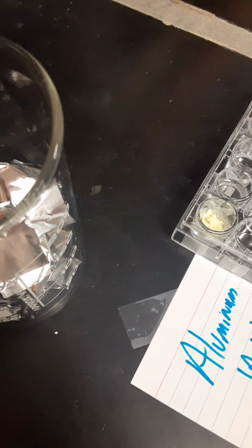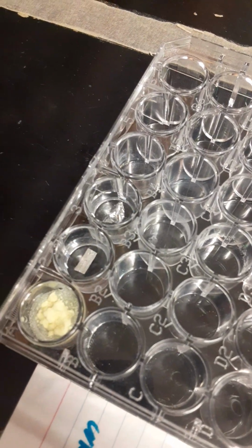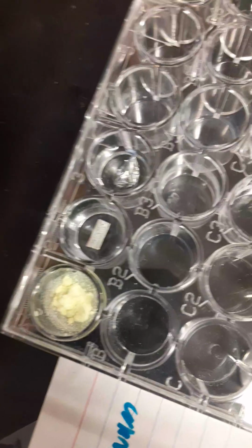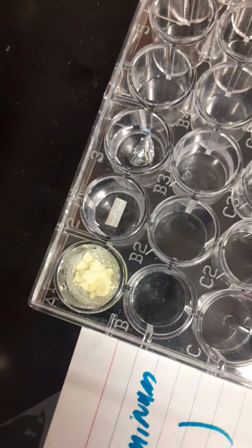And then we'll move to aluminum. Same thing, we will grab a small piece of aluminum, ball it into a piece of foil, or into a ball, excuse me, add it to A3. Okay, we're seeing any reactions going on, any sign of bubbles or steam or anything like that indicates a reaction. All right, now you should record each one of those observations in your data table 2, which is on page 3.